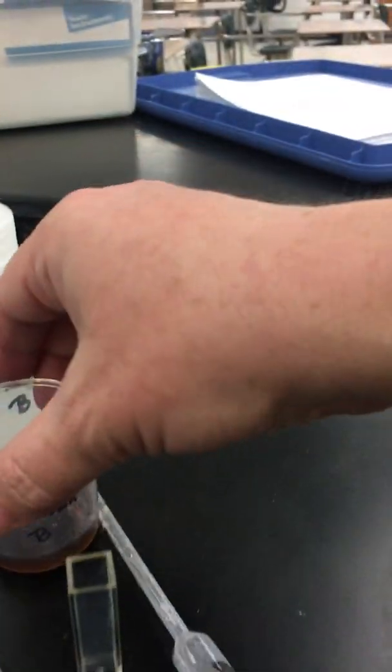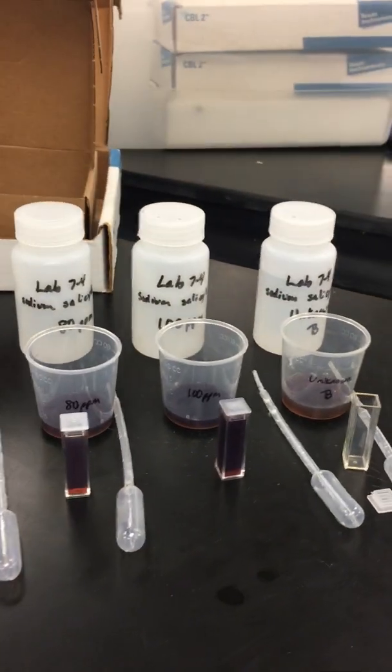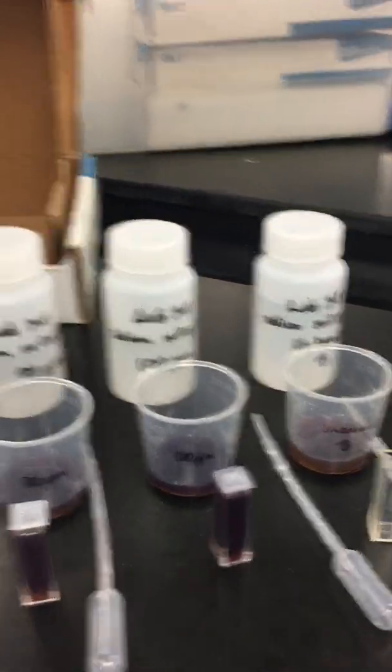So I'm going to pull that out. I'm going to add iron chloride to our unknown sample, and it takes 5 milliliters. So 2 of those equals 5 milliliters. All right, you will see that it changed from clear to a color. So at this point, you should make your hypothesis.